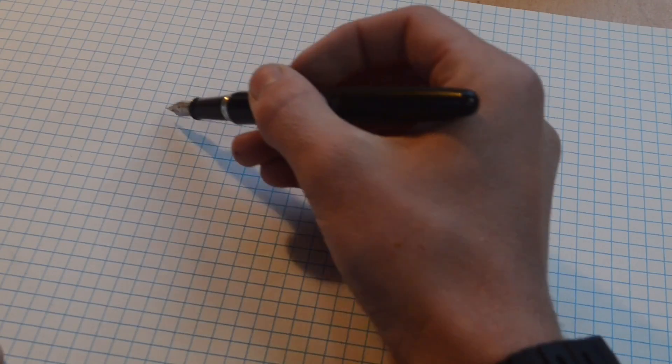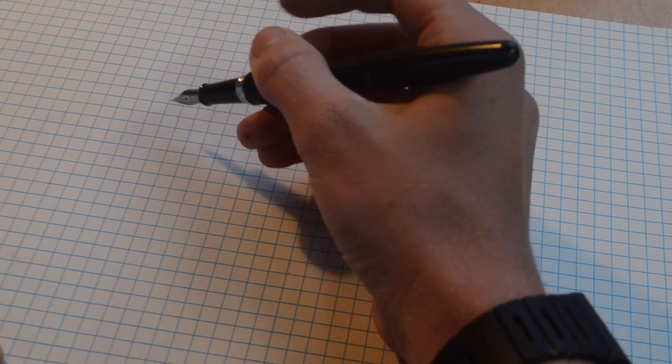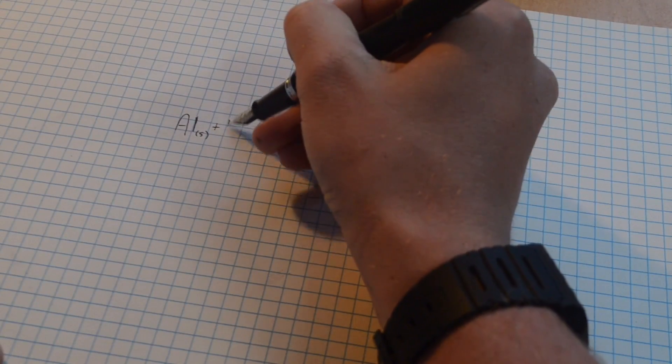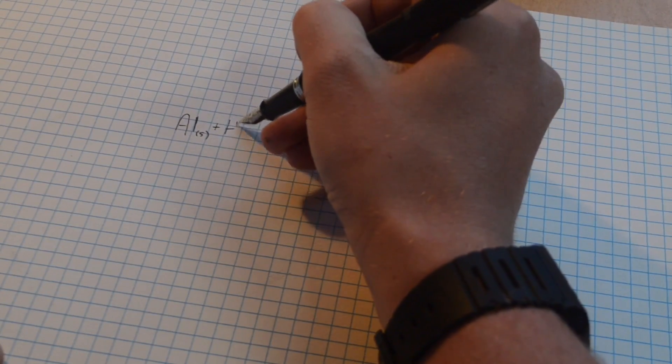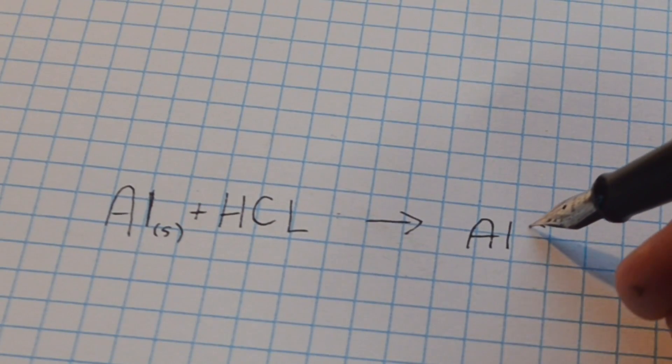Today's video is going to be more chemistry related than my usual videos. The chemical equation for this reaction is as follows: aluminum in a solid state is going to react with hydrochloric acid, and this reaction is going to produce aluminum chloride.